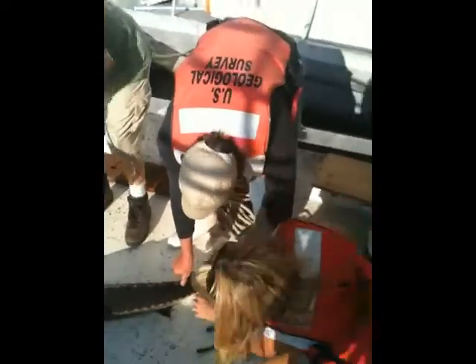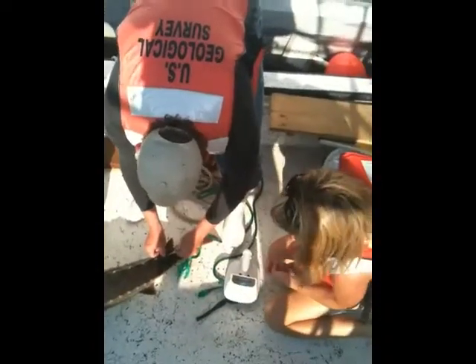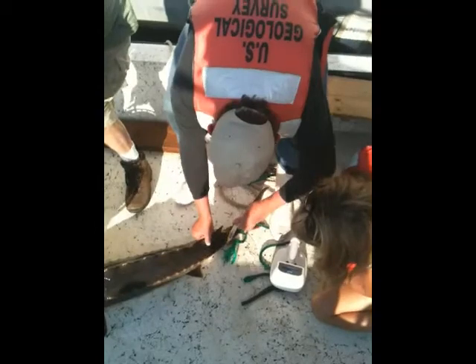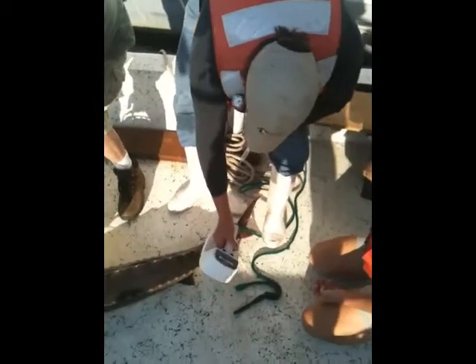Feel this right here. What we're going to do is a shallow angle. You can put it in. You can ease back while pushing — I'll push through it. 16-digit long number.